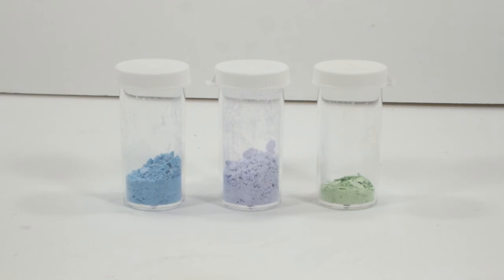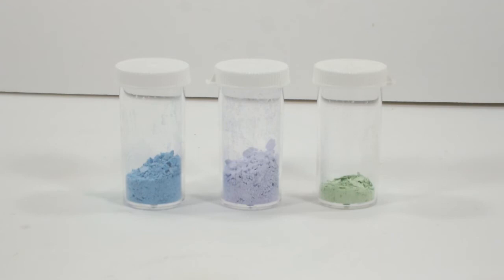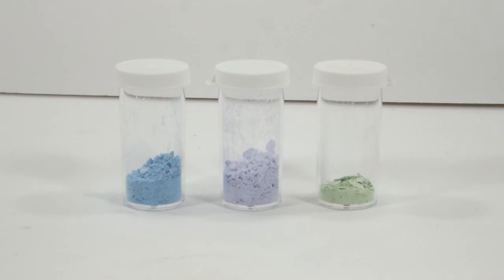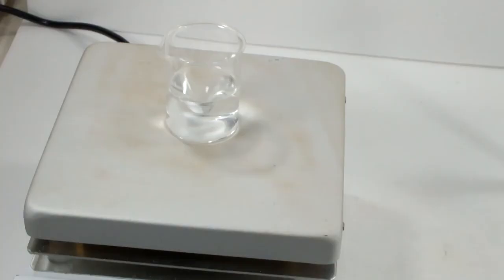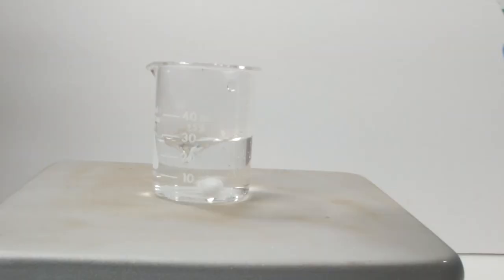As for the green stuff, well, it's not that ugly of a color. There's not very much of it, and I didn't even bother to weigh it. The main takeaway from this is that using a barium compound and nickel sulfate does work to form the hexamine nickel-2 complex of whatever the barium salt anion was, which got my beaker turning. That's my brand new turn of phrase for thinking up a creative idea, by the way.